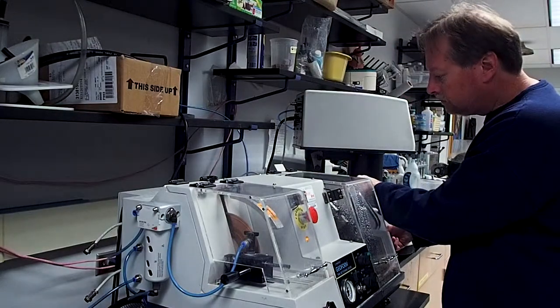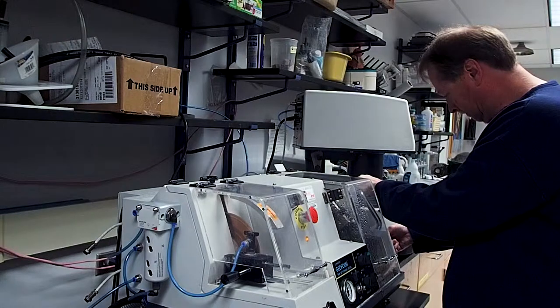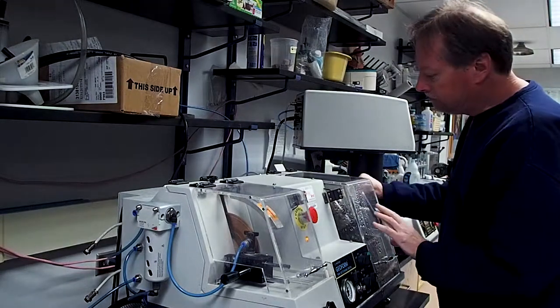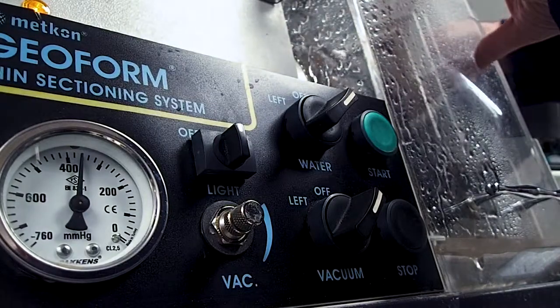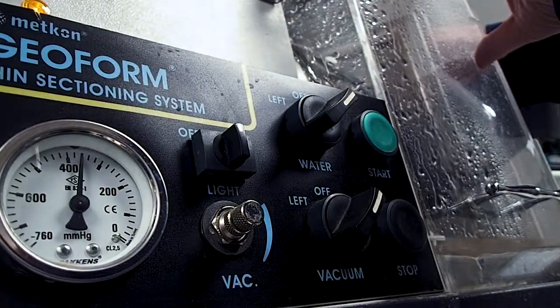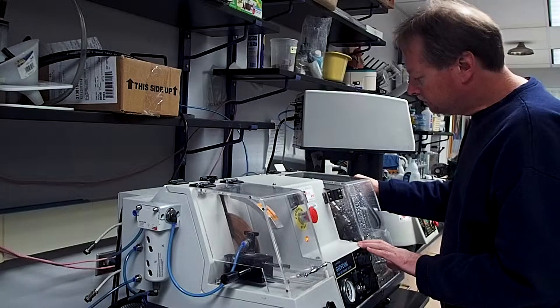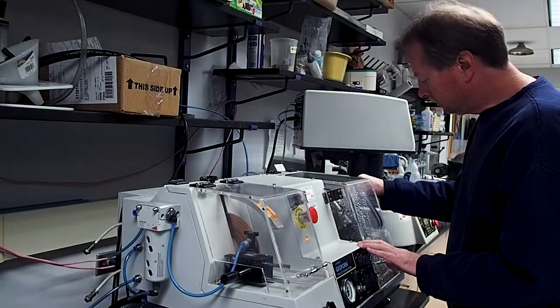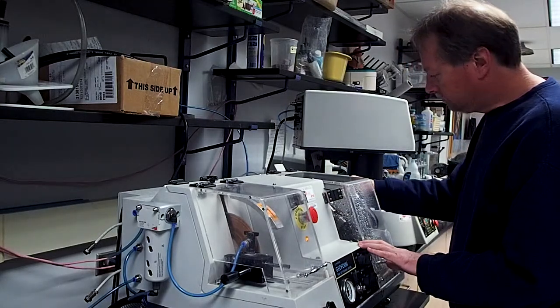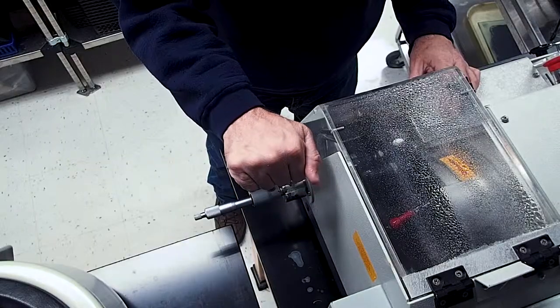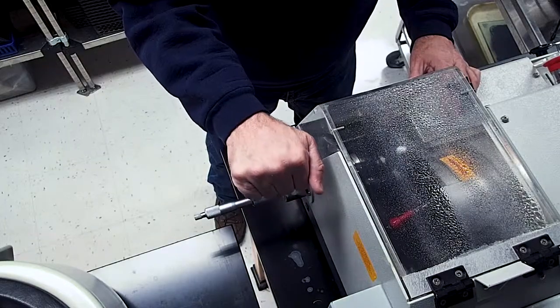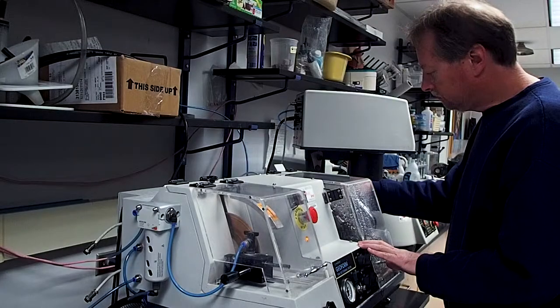Continue to carefully advance the vacuum chuck, gently rocking the sample back and forth across the grinding wheel until you can hear and feel that the wheel is in constant contact with the surface of the rock sample. Do your best to keep only the rock in contact with the grinding wheel. Rocking the slide too far in either direction such that the rock moves on and off of the grinding wheel may create an uneven surface or damage your thin section.